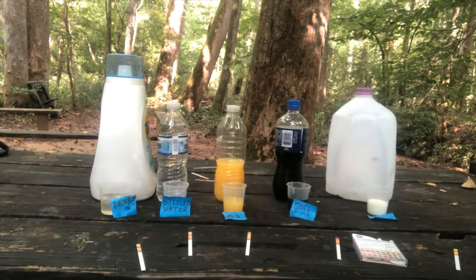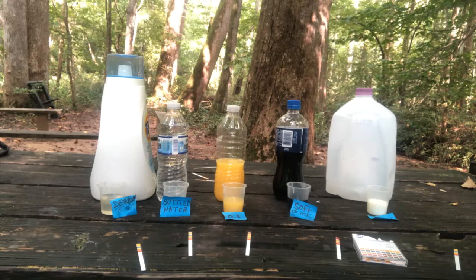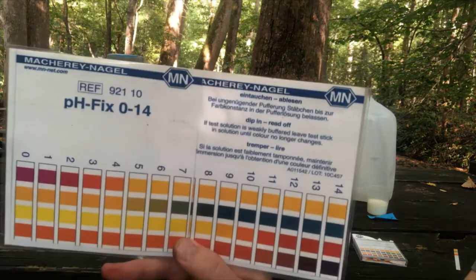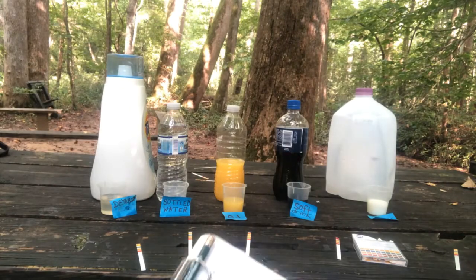Were you surprised at any of the results? You know, we definitely had some acidic substances here. Did we have any that were above 7? Nothing really high on the chart, but of 0 to 14, we did get some that were above 7, I believe. Did you agree?